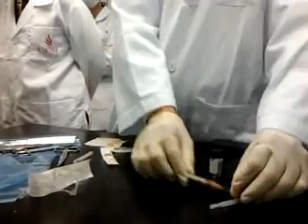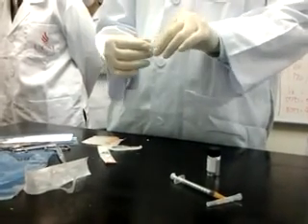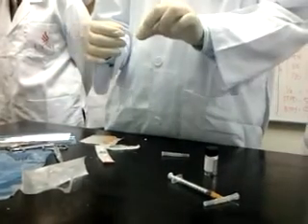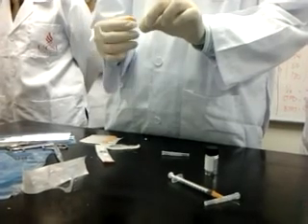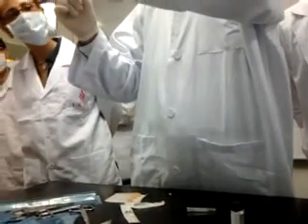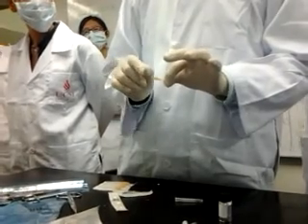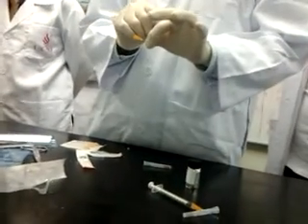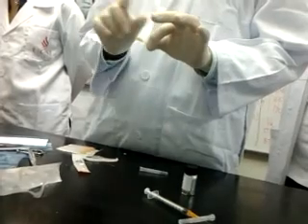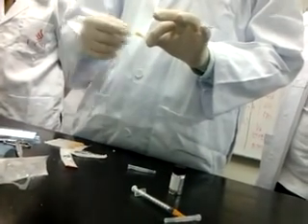Before I do anything yet, remember when I use my needle to pierce between the loose skin, I can feel the needle go inside the loose skin, and I can see the needle through it, both fingers outside the skin. When I pull my plunger, I create a negative pressure because I do not want to go into any artery or any other mass. So the plunger is supposed to go back. Because I put a negative pressure, it goes back. That means it doesn't go into any blood vessel.